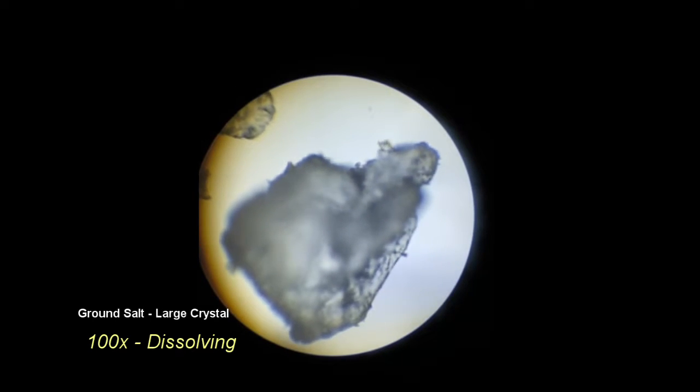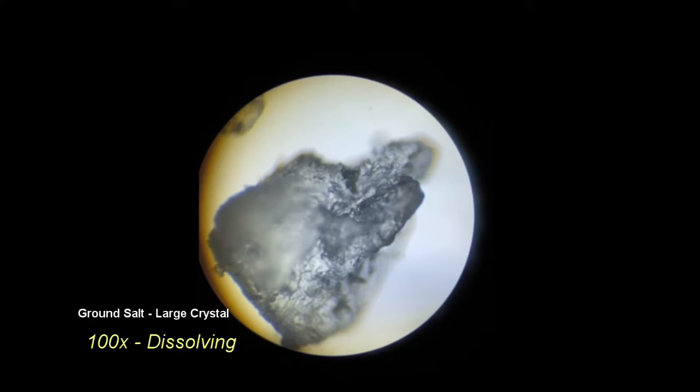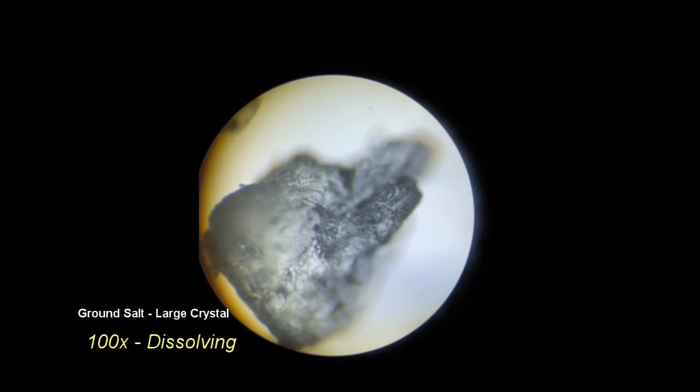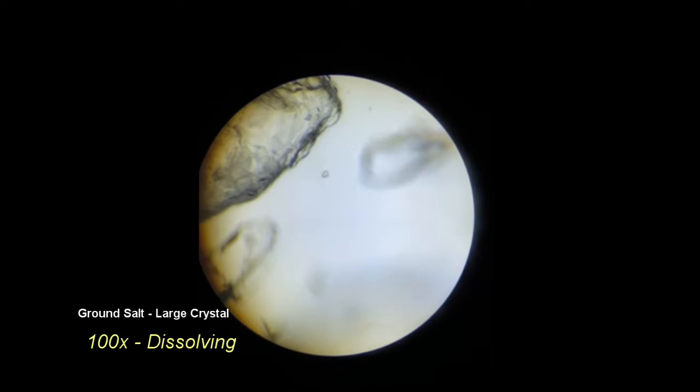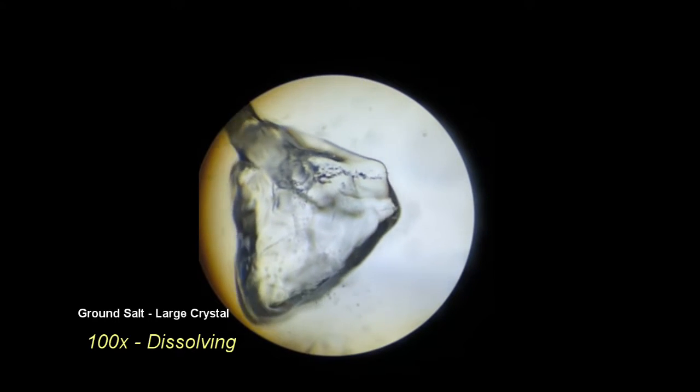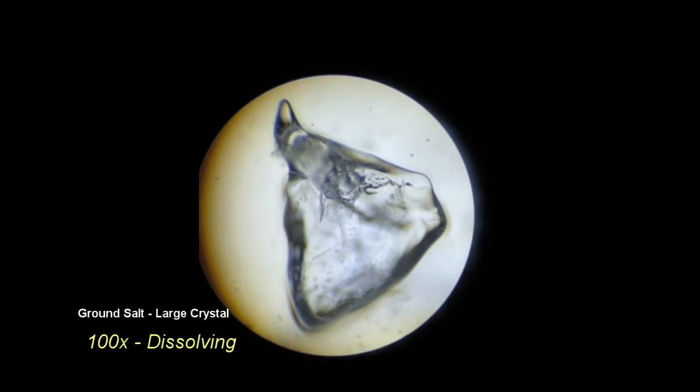The visual effects of dissolution were most dramatic in this clip. This is a larger crystal from the ground Himalayan sea salt. After the distilled water is applied, the effects of dissolving are easily visualized, and parts of the crystal can be seen cracking off and disappearing. Some of the motion around the crystal as it dissolves is also much more rapid.